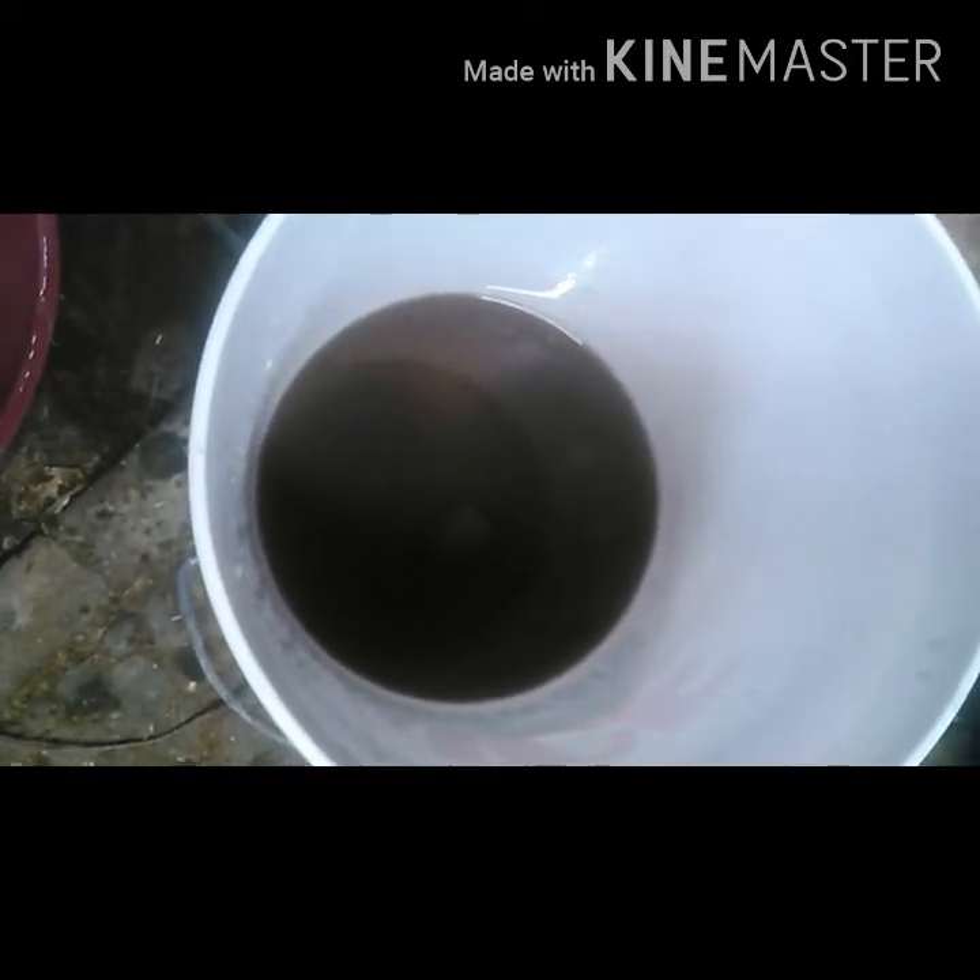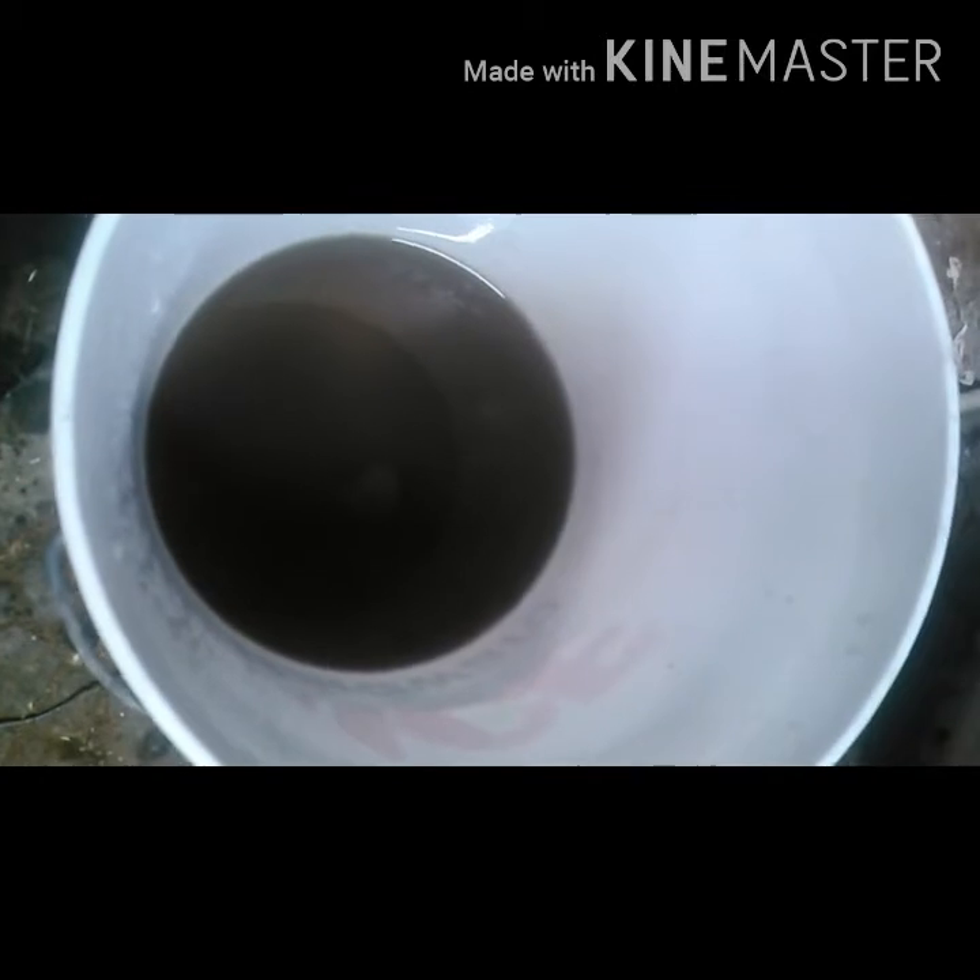At the end of that video, the original starting boiling flask is where this liquid came from. I've dumped it out of the original boiling flask into here and it's cooled and it's got some crystals starting to form. I've added a little bit of distilled water and I'm going to filter it off and then start boiling the water off to make the crystals come out of solution faster. I'm going to go ahead and filter this right here and then I'll start boiling it. Be right back.